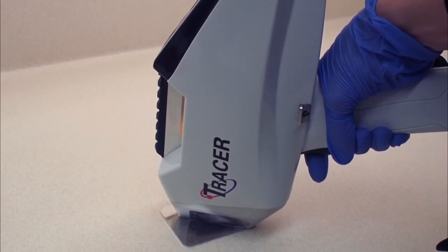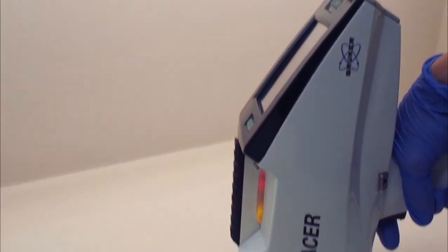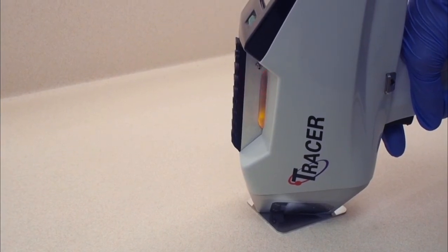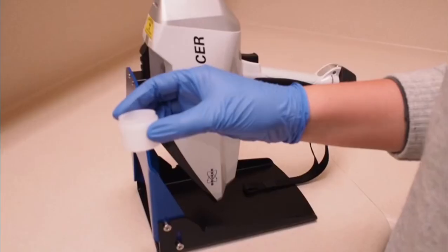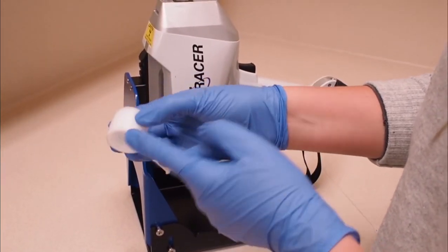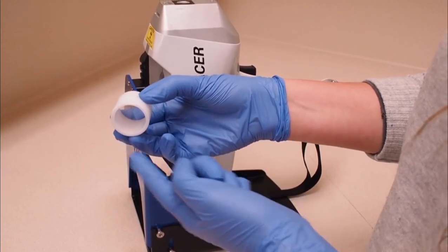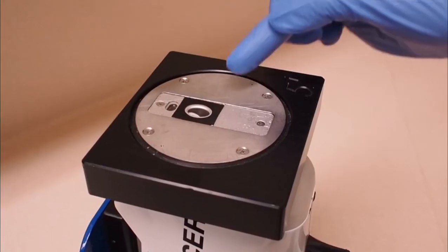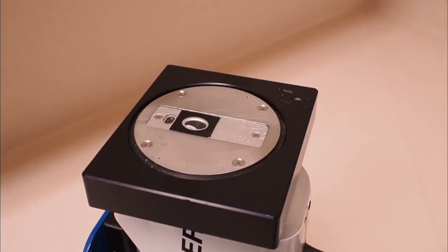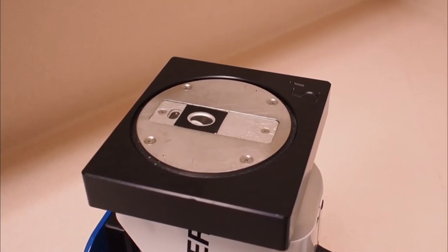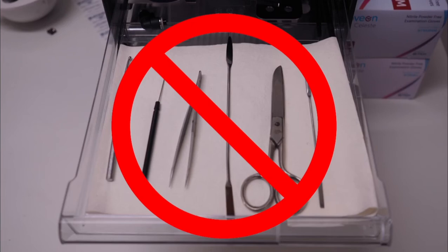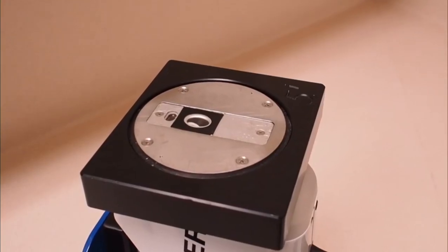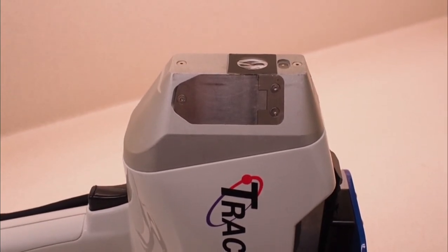If using these or other material, it is good practice to collect a spectrum from these materials to understand how they could be affecting the observed composition of your sample. If you have liquid or loose powder samples, sample cups can be supplied as well. Remember that you should never touch the analysis window as this could lead to contamination that will affect your spectra. Also, as this window is a thin polypropylene film, you should never place any sharp samples on it. The analysis window will break if subjected to sharp edges, points and or too much pressure.